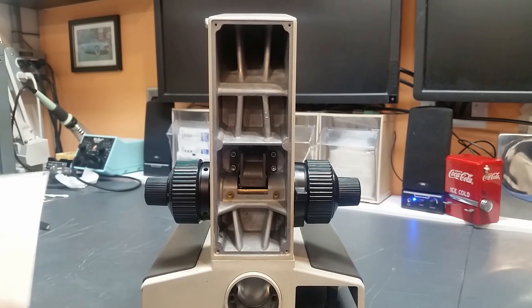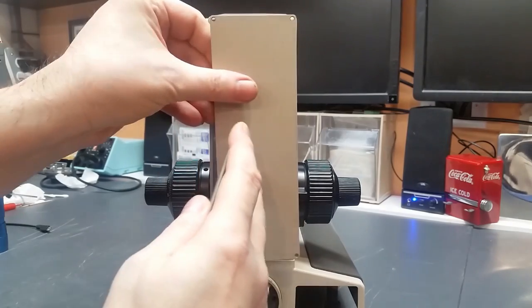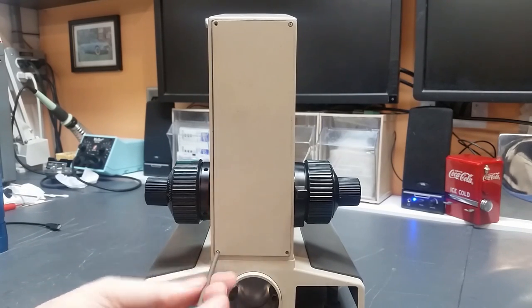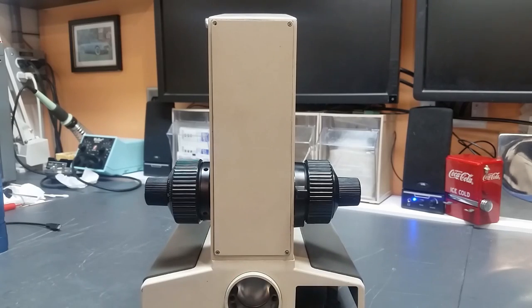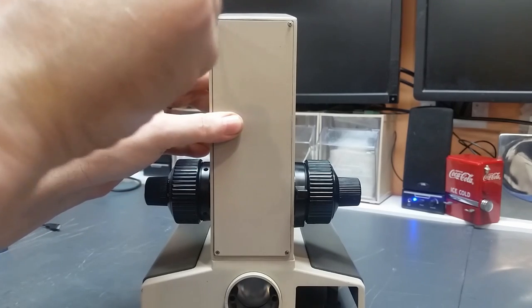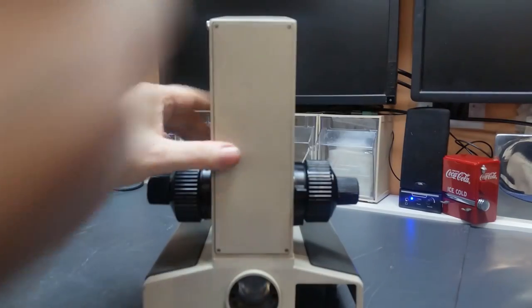Okay, now I'll reinstall the rear cover. There are four M2 metric screws. What I do is I install these all loosely. Once all four are in place, then I go back and snug them up. That way I get the best fit on the rear cover that I can get. Now hold this in place while I put the last one in. Whoops. Okay. And then I'm going to go back and snug these screws down. Go to the opposite corner and snug that one. And then the remaining two corners. Okay, rear cover is reinstalled.